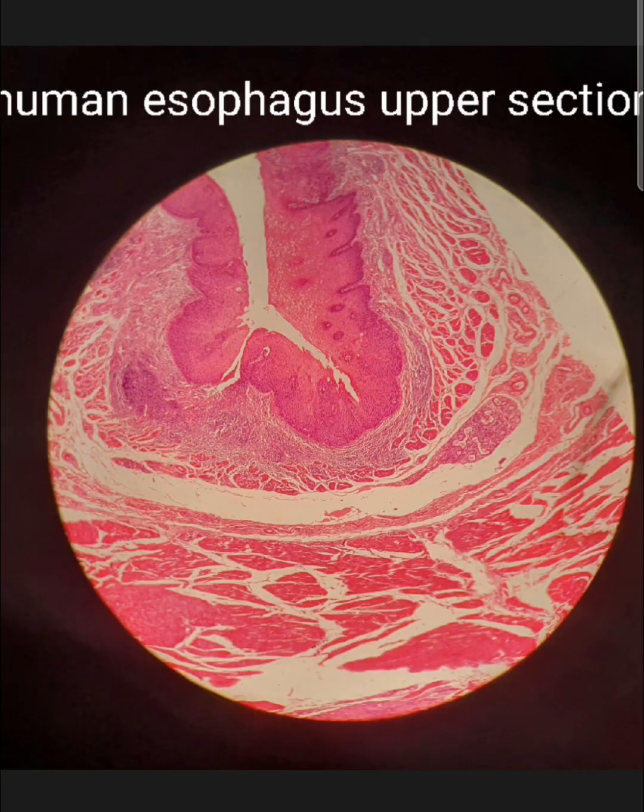This is the histological section of the upper part of the esophagus, which contains stratified squamous, non-keratinized epithelium. It has the thickest muscularis mucosa. It has a longitudinal mucosal fold. It contains submucosal glands, and it is of a mixed nature. It contains skeletal and smooth muscles.